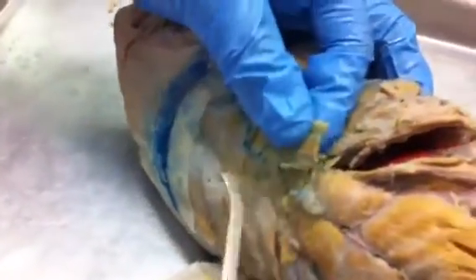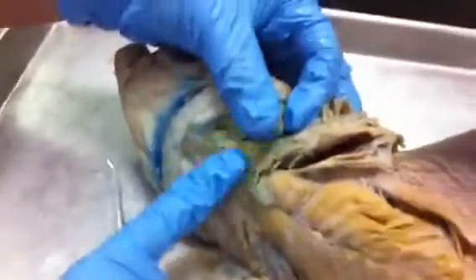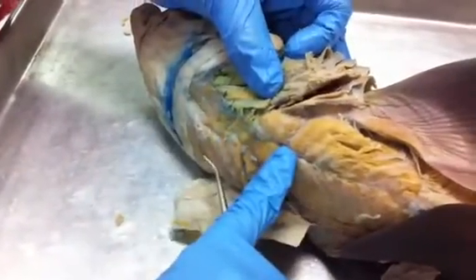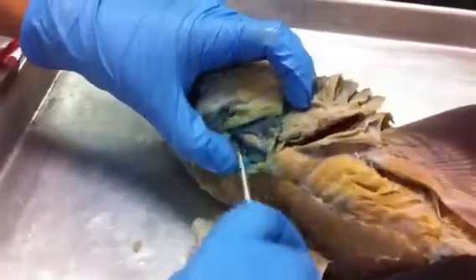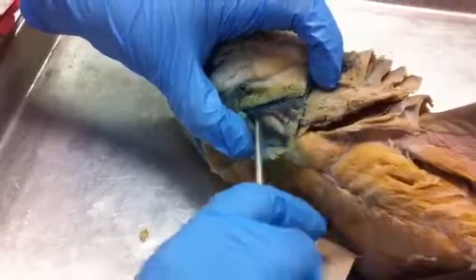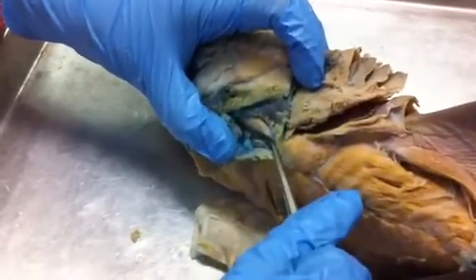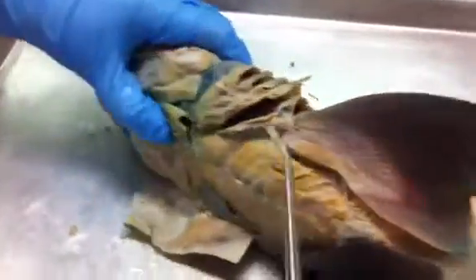So pretty much, this whole thing right here, is this what you were pointing to? Yeah. This is the coracomandibular muscle, because these two things are our coracoids, and anything that runs from our coracoids up to our mandible is going to be a coracomandibular muscle. Okay. But underneath it, these muscles go to the second arch because they're deeper. And so these are going to be your coracohyoid muscles. Okay. So I think we're done on this end.